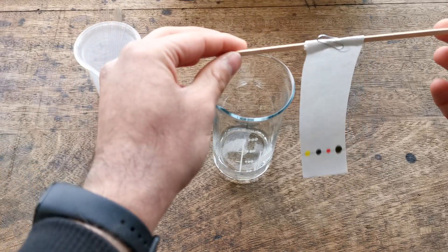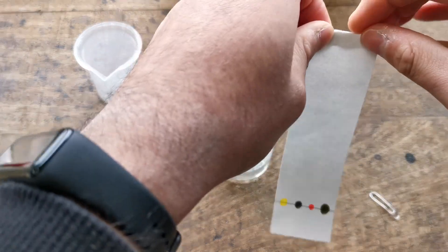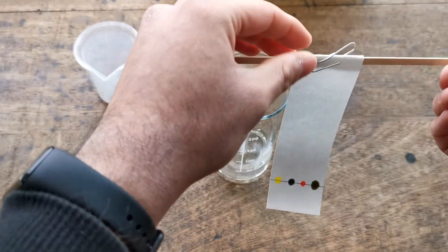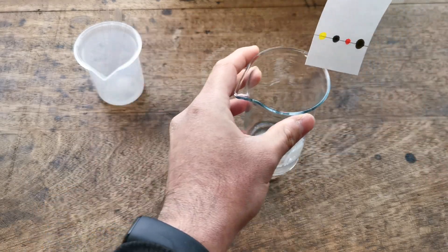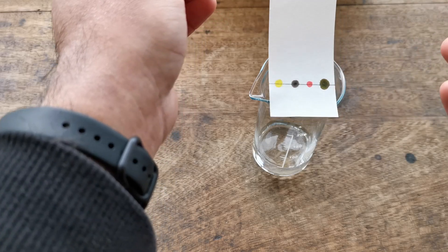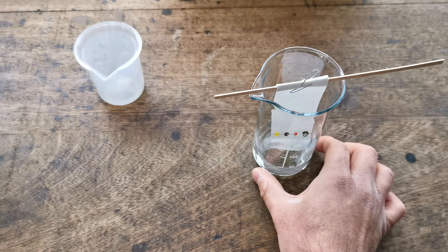We're going to test it first. If the pencil line would go below the solvent level we need to twist the paper around a few more times. If the solvent level goes above or touches the pencil line, then you have to start again. Now the solvent level is below the pencil line and it's ready to be placed in.